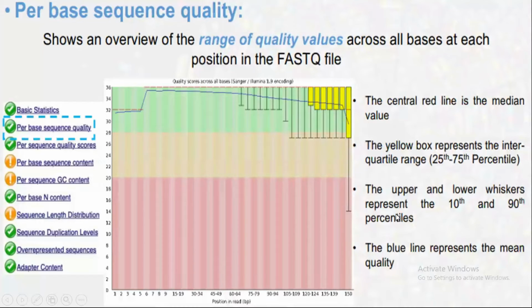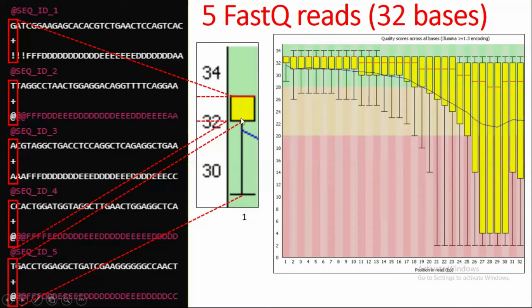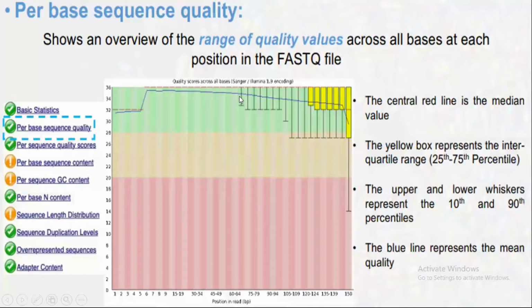Basically, the central red line is the median value, and the yellow box represents the interquartile range, 25 to 75 percentile. So what I was telling is that about 50% of your data is here. About 50% of our sequences have good quality. For the first base, 50% of the bases have good quality.